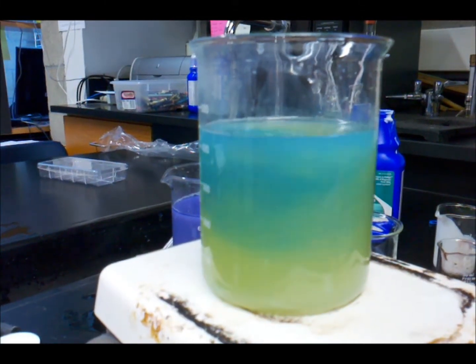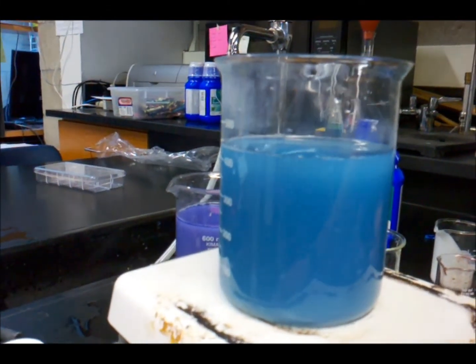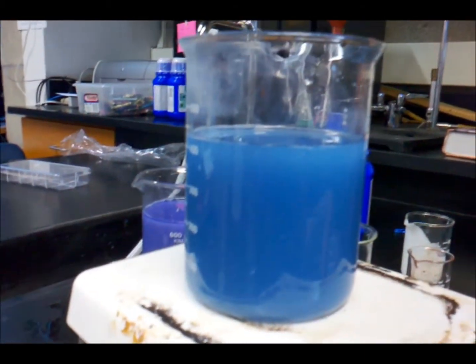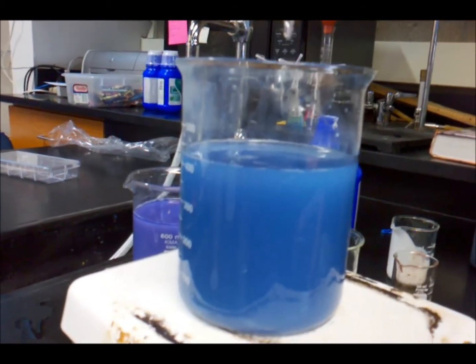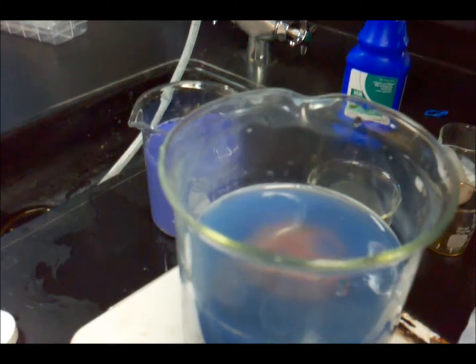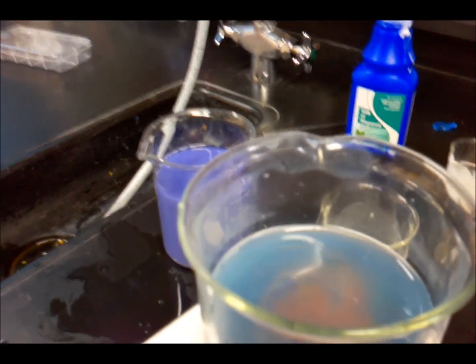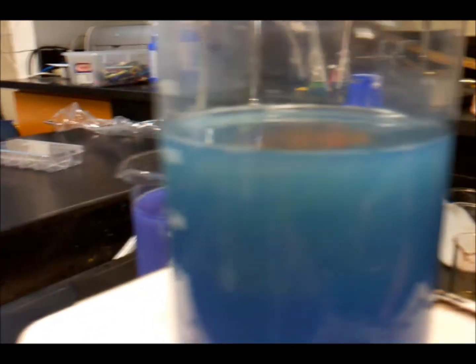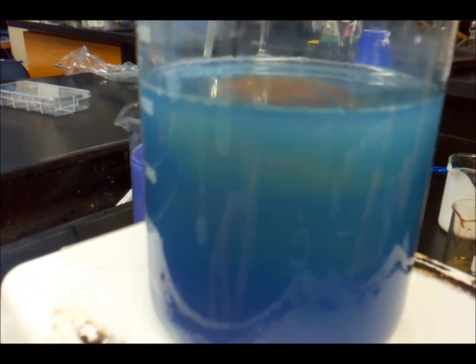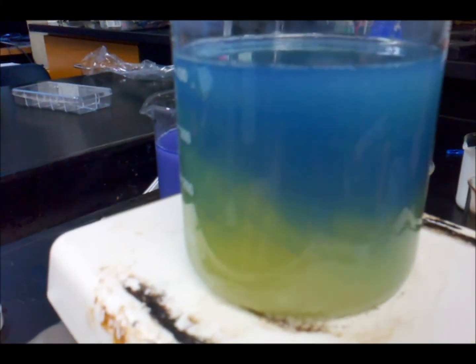Let's write this down. Nice. Slow it. Yeah. Then it's just going to... slow it down to zero and then add it, then add a bunch of it. And then we'll watch it. Whoa. Now the top layer is like... Alright, let's start mixing it now. Start slowly. Oh, sorry. Don't go down. Oh, haha. Nice.